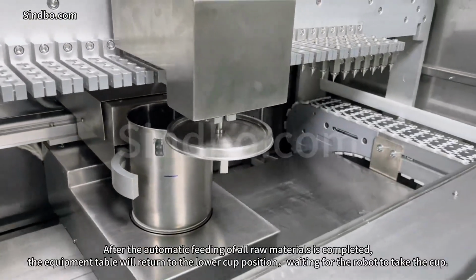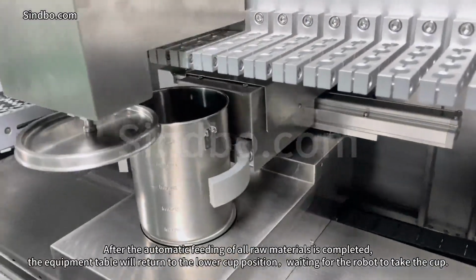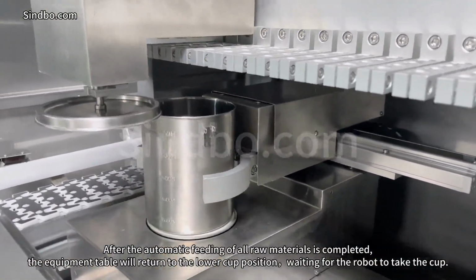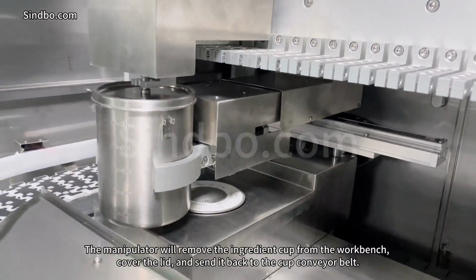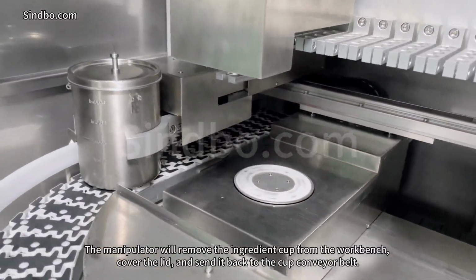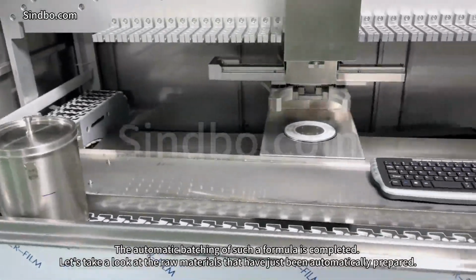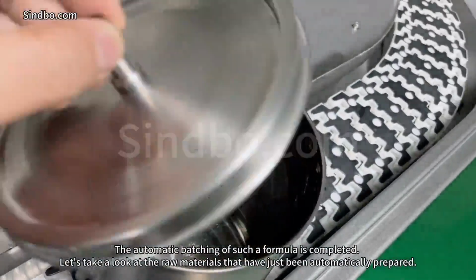After the automatic feeding of all raw materials is completed, the equipment table will return to the lower cup position, waiting for the robot to take the cup. The manipulator will remove the ingredient cup from the workbench, cover the lid, and send it back to the cup conveyor belt. The automatic batching of this formula is completed. Let's take a look at the raw materials that have just been automatically prepared.